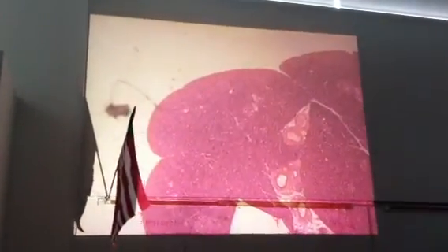All right, so slides are a little bit scattered. And I'll continue to scatter them every time I show them so we don't just get into a pattern of looking at the same thing every time. And we're in the pancreas here, and the pancreatic islet we had seen before. And it's right here, but the bulk of everything that's there are going to be acinar cells. And this is where we're going to be producing our digestive enzymes.